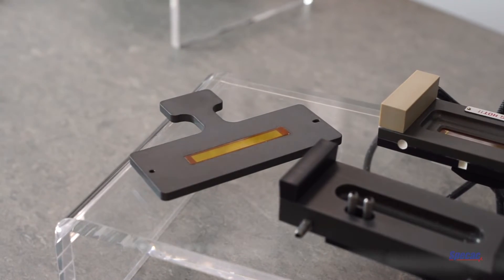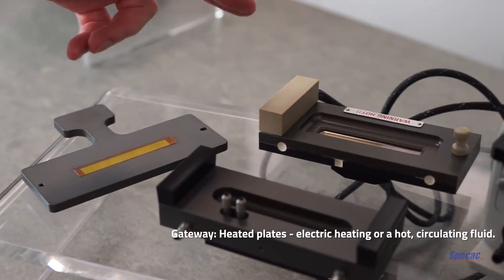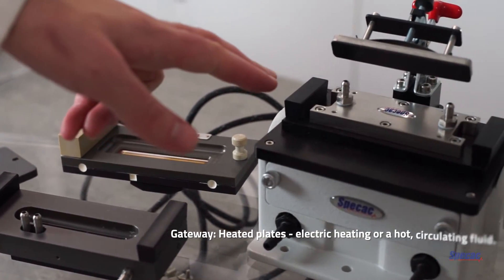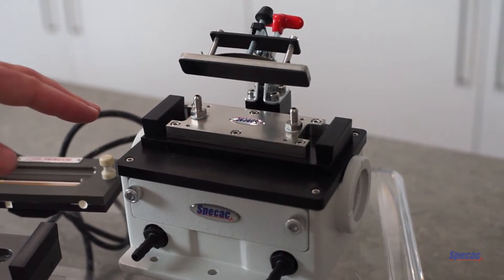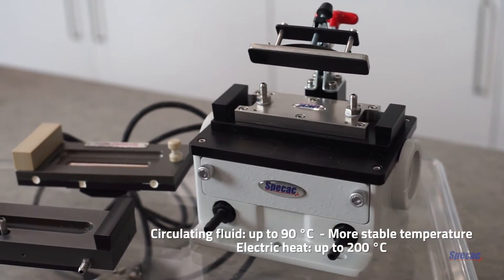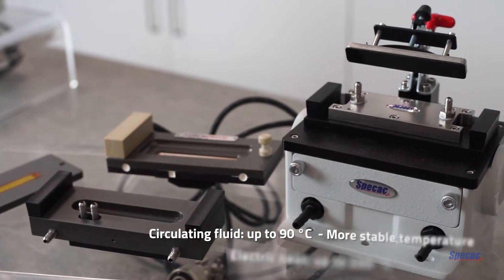For the Gateway, in addition to the standard flat plates, we also have heated plates that can be heated either electrically or using a hot circulating fluid. We also have flow cells through which the sample can be flowed, and there's also a heated version of that too. Plates heated by a circulating fluid have a maximum temperature of 90 degrees Celsius, while the electrically heated plate can reach 200 degrees Celsius.